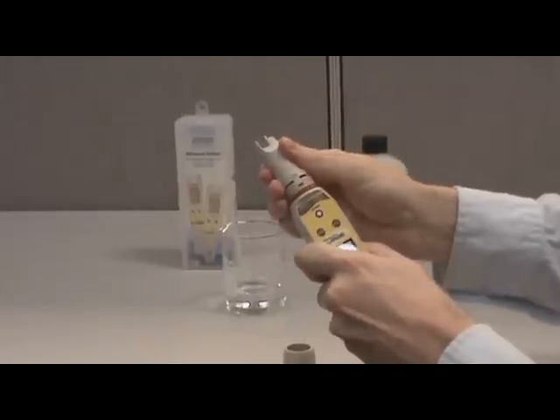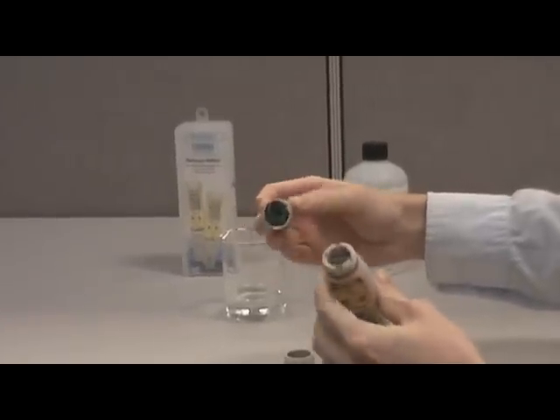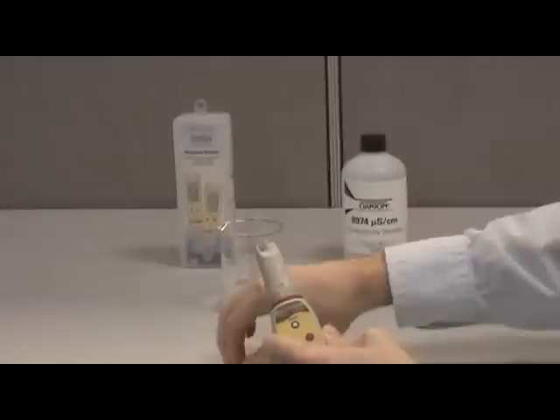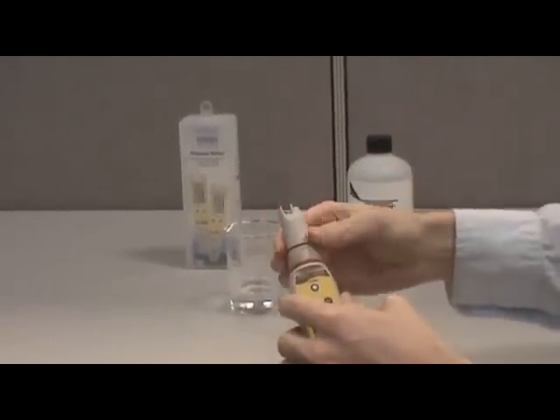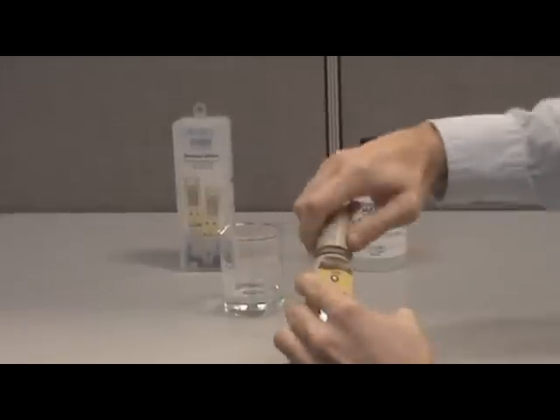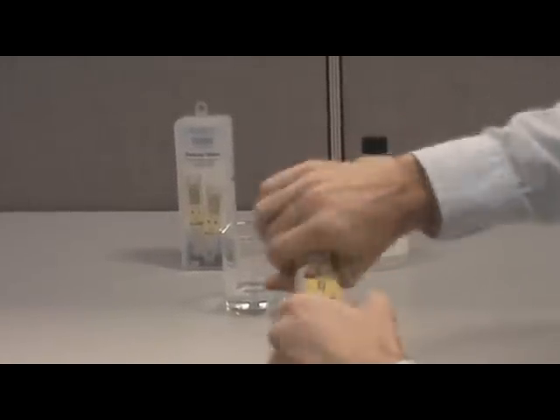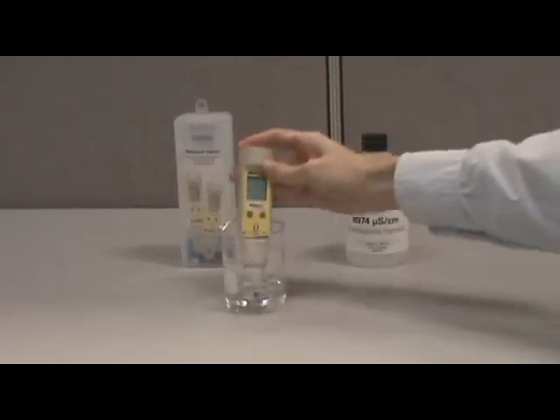Once the collar is removed, carefully pull the sensor from the body of the tester. You can now replace the sensor by pushing it back into the body, making sure the pins are correctly aligned. Replace the O-rings and screw the collar back into the tester body using a clockwise motion. After replacing the sensor, make sure you calibrate the tester and maintain a calibration schedule.